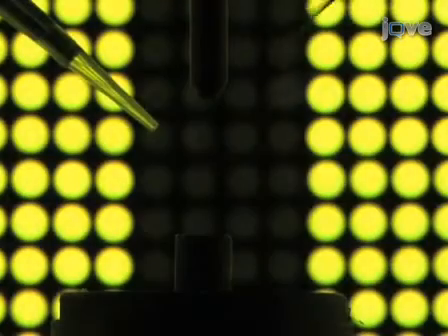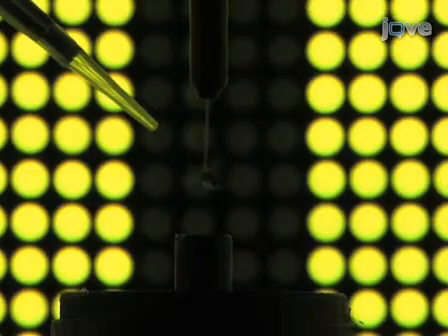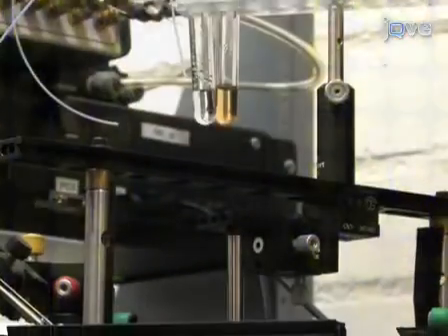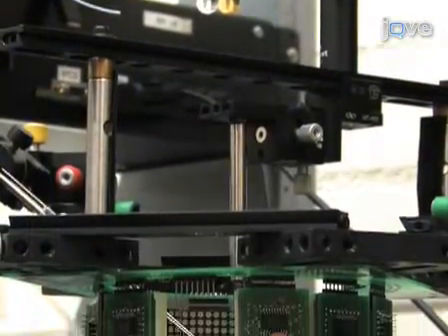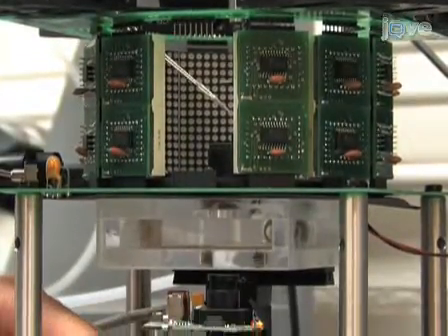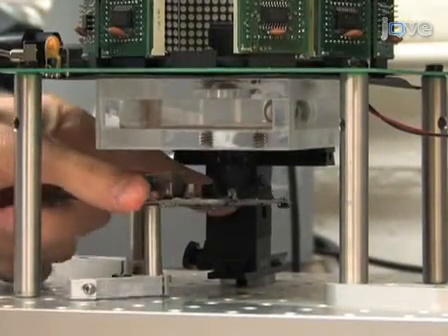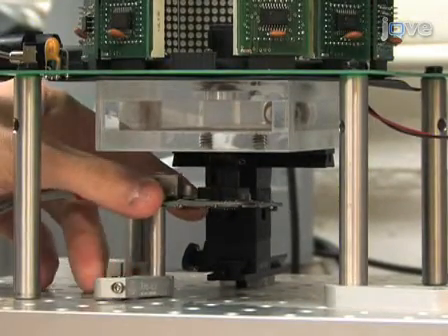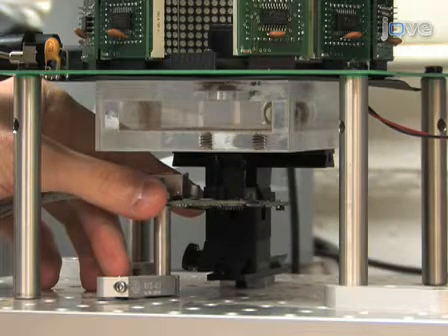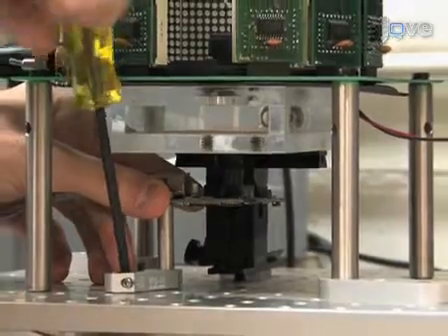Optimizing the video image is crucial for the quality of the acquired data. To obtain cleaner images, first place a freshly tethered fly in the arena using a pair of forceps. Next, position the FireWire board camera under the clear acrylic vacuum chamber such that the camera points directly upward through the chamber, through the glass vacuum tube, to the ventral aspect of the tethered fly. Be sure that there is no infrared filter coating on the lens of the video system.